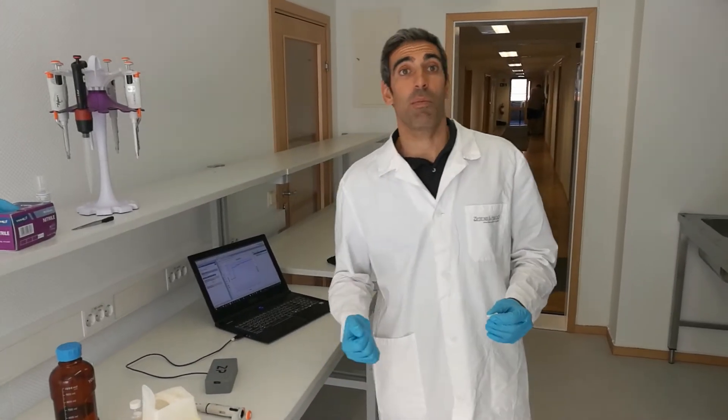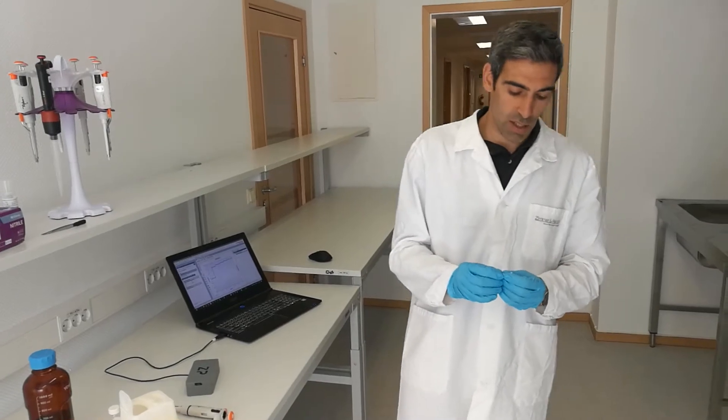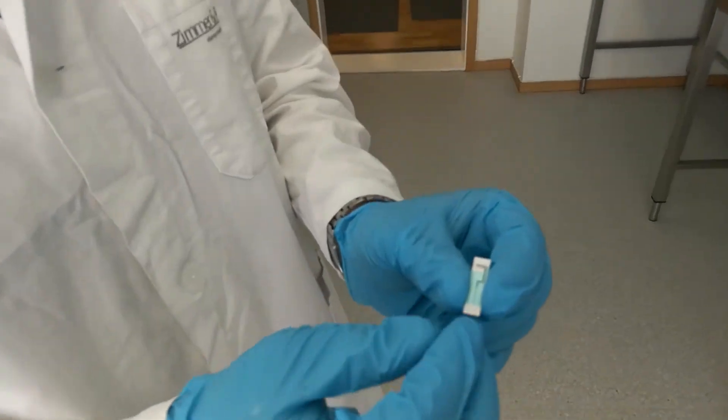Hello, my name is André. I'm a scientist here at Zimmer Peacock. What I'm going to show you is a small demonstration about the potassium sensor and how we test them.